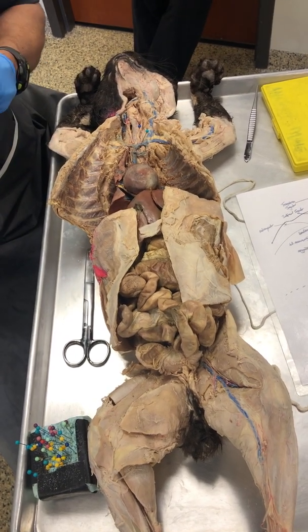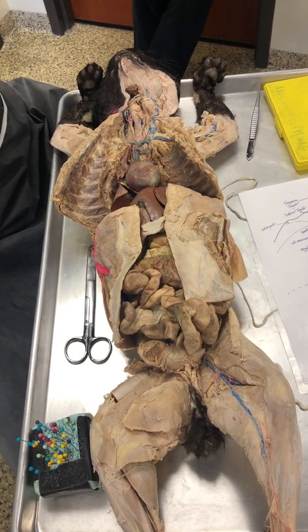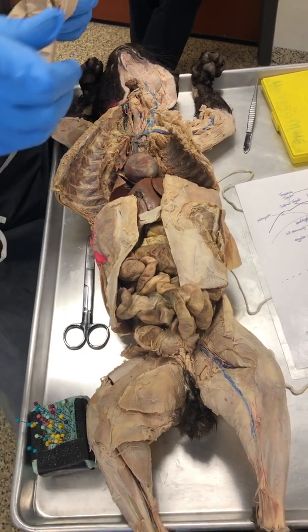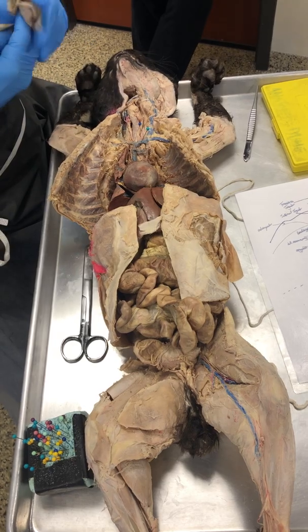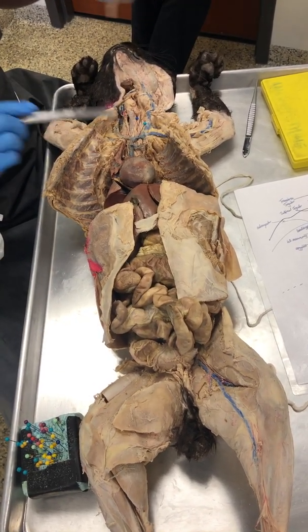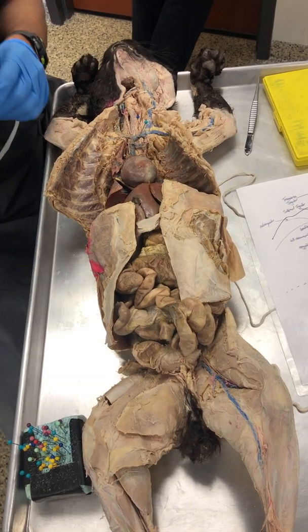But like I said, of those 3 or 4 cats, one of them we will see it. So on one of the cats, I need to just find which one it is. So what I'm doing is I'm putting the pin there to see where it would be if it were present.